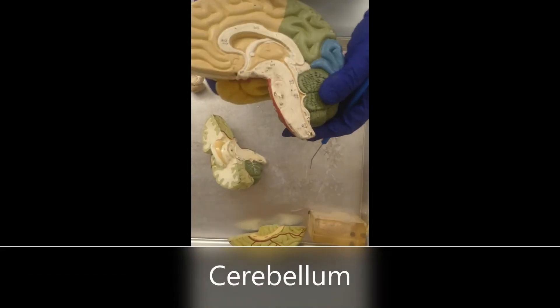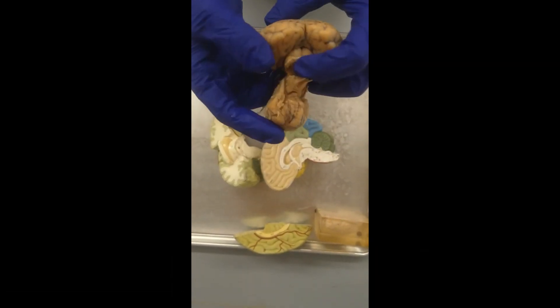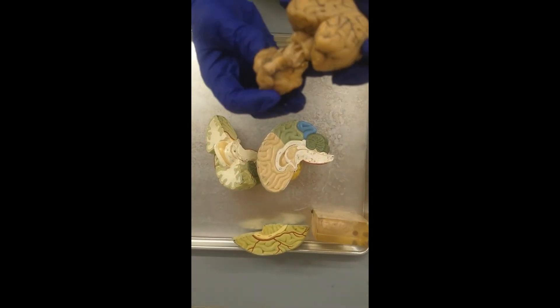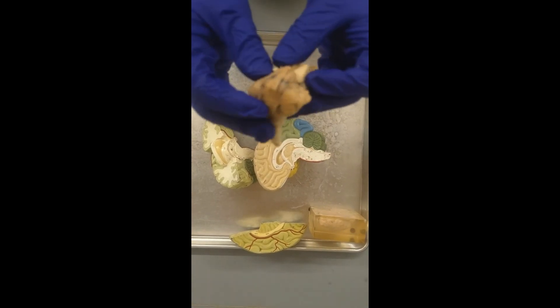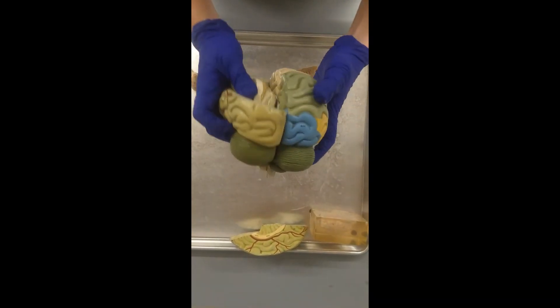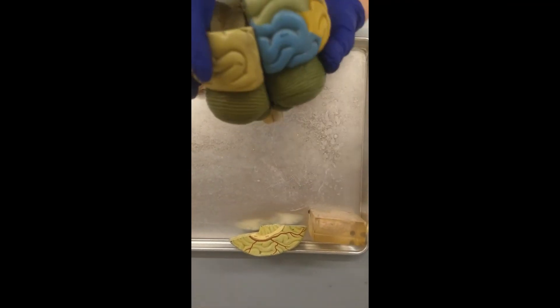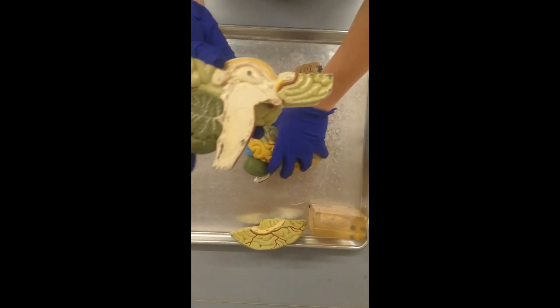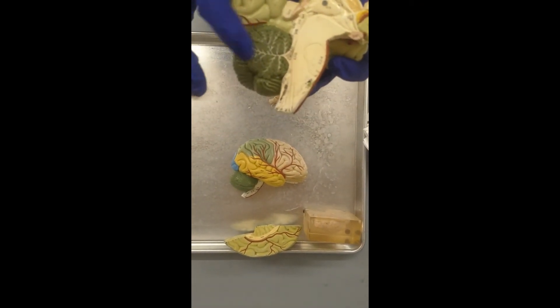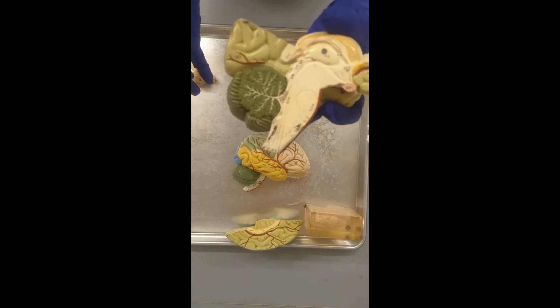On to our last division of the brain — the cerebellum. On the whole sheep brain, the cerebellum was reflected to show you the corpora quadrigemina — the superior and inferior colliculi. Cerebellum is going to be a lot of balance relay information. If we open this up, there's going to be a lot of this branching white matter. That branching white matter is going to be the arbor vitae — the tree of life.